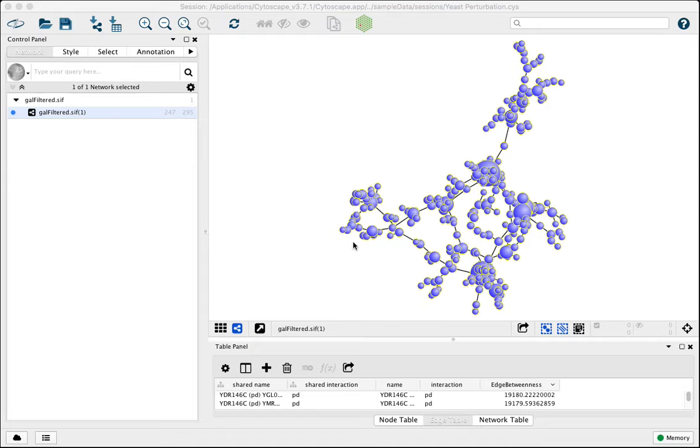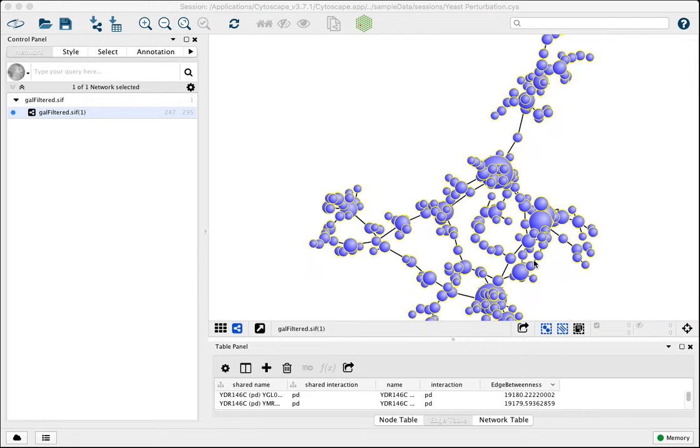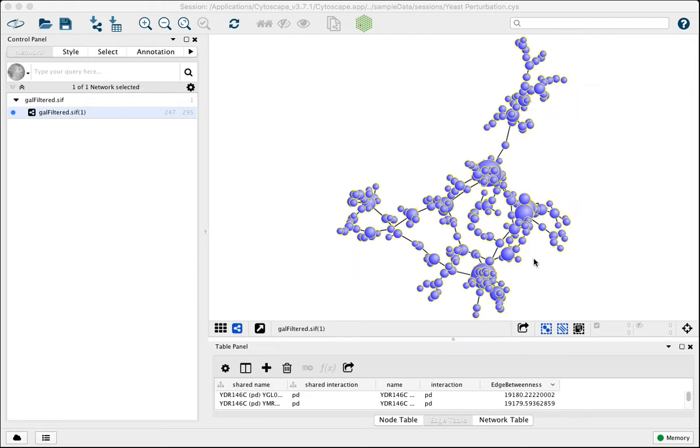Cytoscape 3.7.1, and today we're going to look at advanced layout options. So here I've opened a standard sample session file and just modified the appearance a bit so it'll be easy to see where nodes are overlapping and maybe clustered a bit too much.